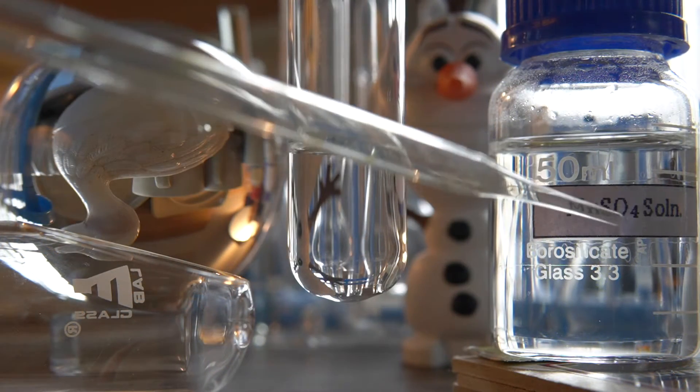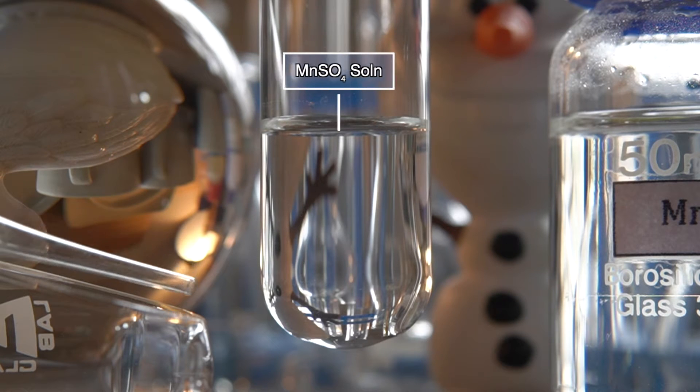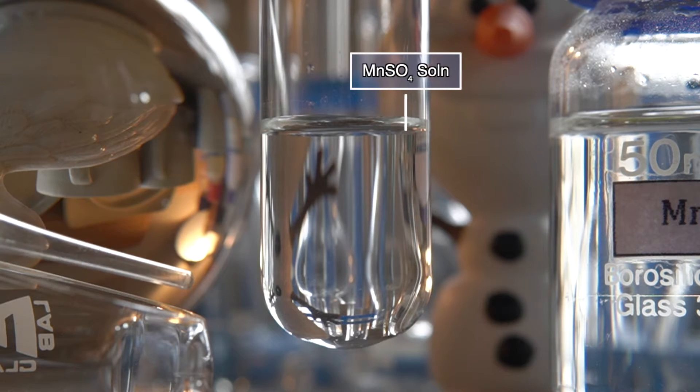Now, to initiate the chemical reaction, we will take some amount of manganese sulfate into this test tube.